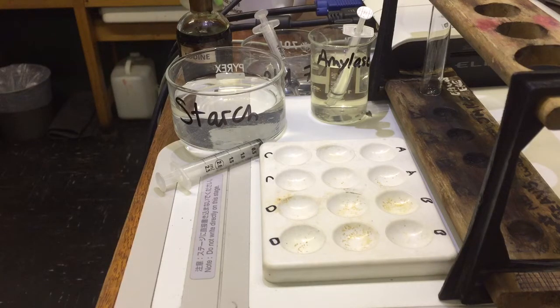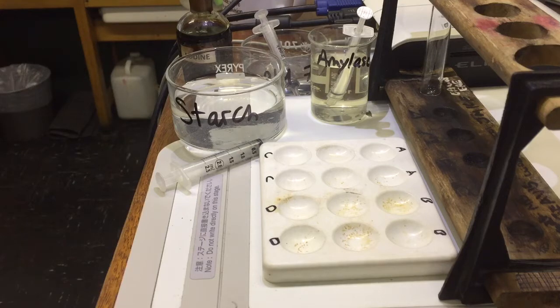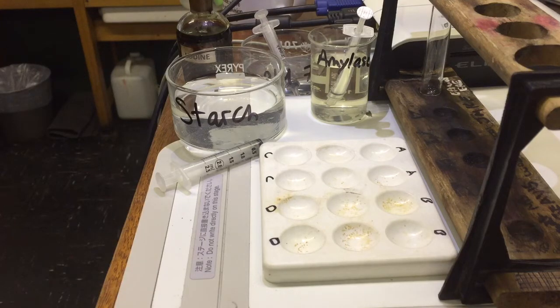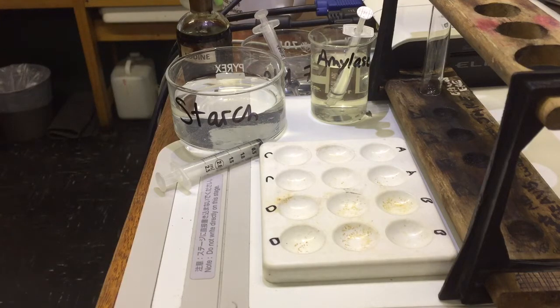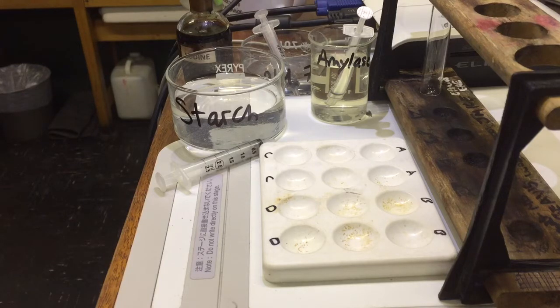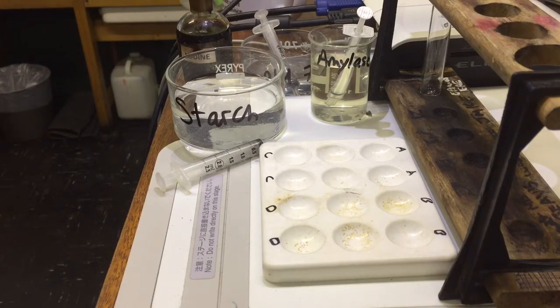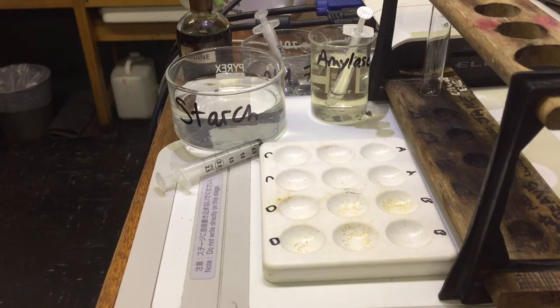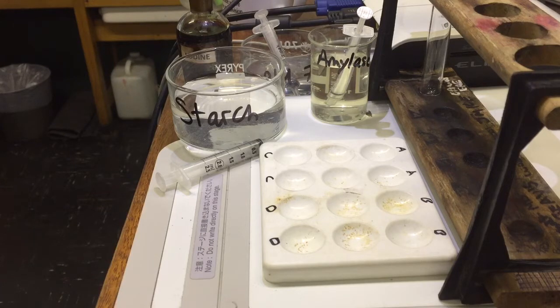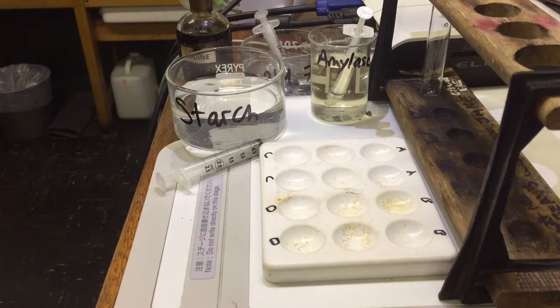Around the room we've got different pH buffers going from 4, 5, 6, 7, and 8. So we've got a variety of different pH buffers. A buffer is just a substance that keeps a pH at a certain level.